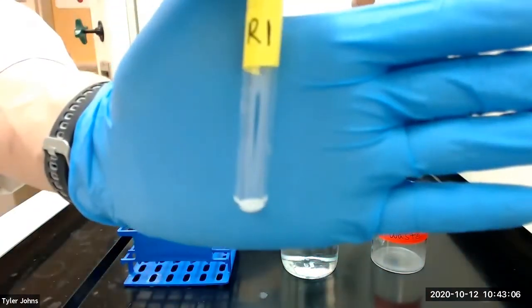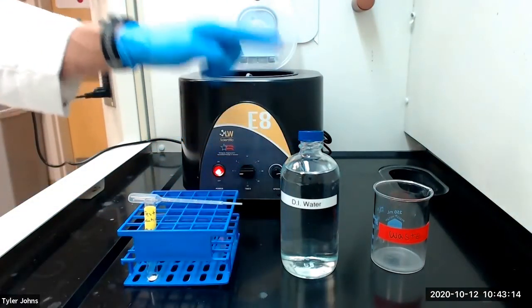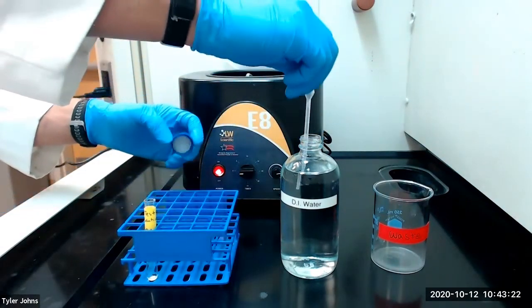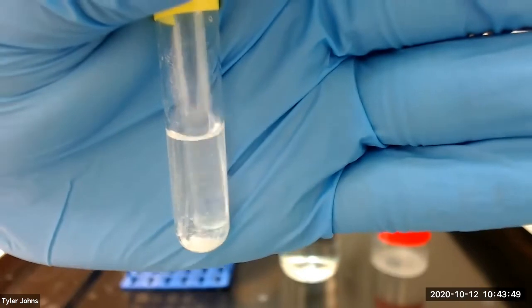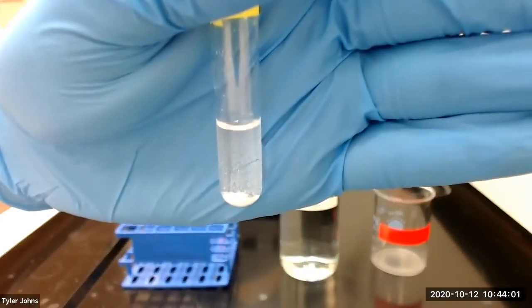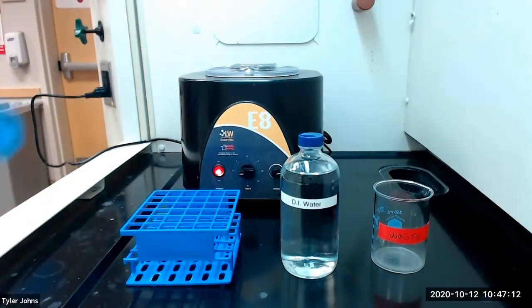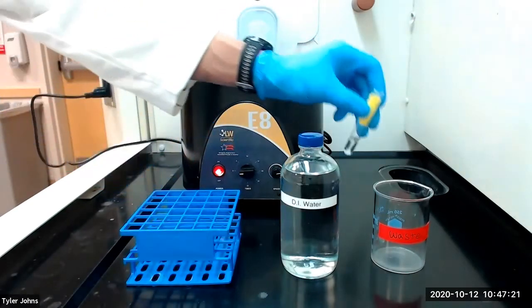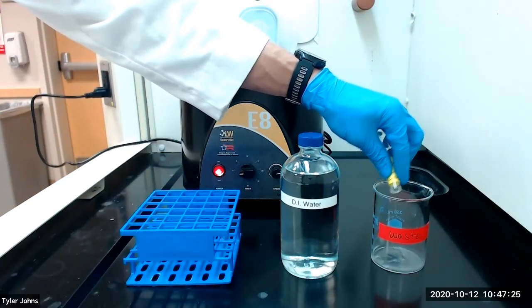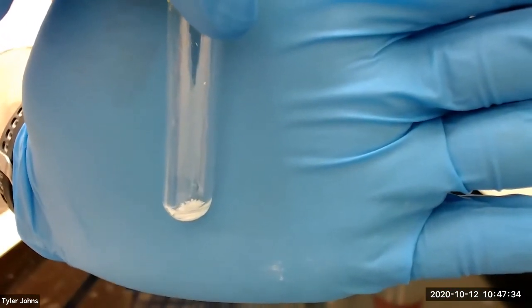We will next wash the residue from our test solution, or R1 for residue one, with a couple of milliliters of deionized water. We'll stir and then we will centrifuge. Once centrifugation is complete, we can remove our test tube with residue one and discard the wash liquid into a waste beaker. Our residue R1 is now ready for further analysis of the group one or chloride ions.